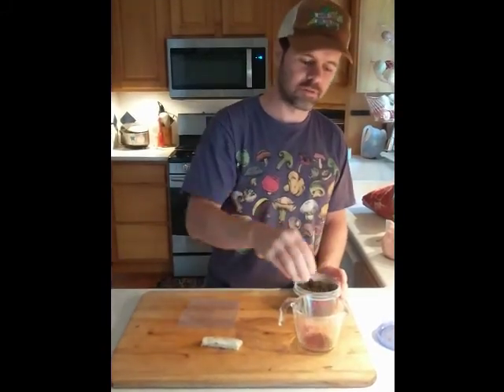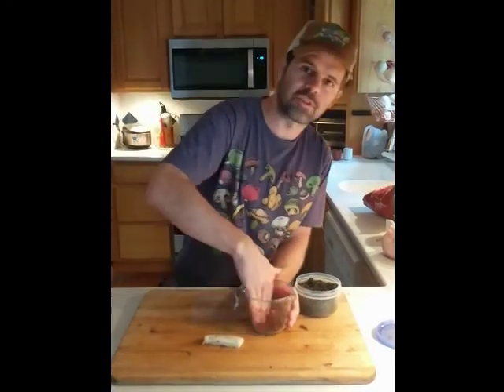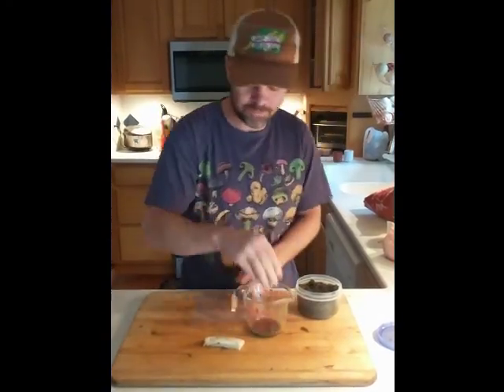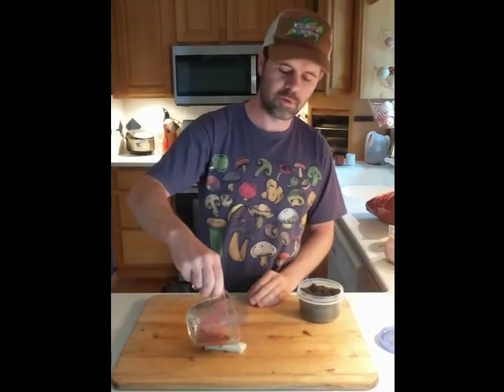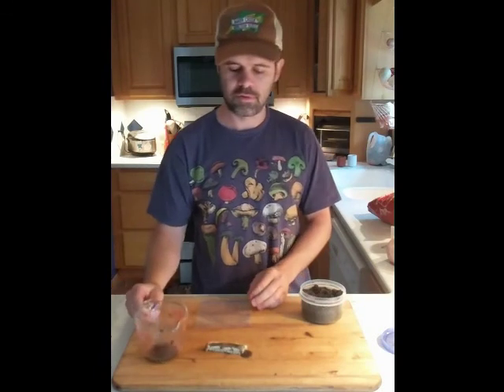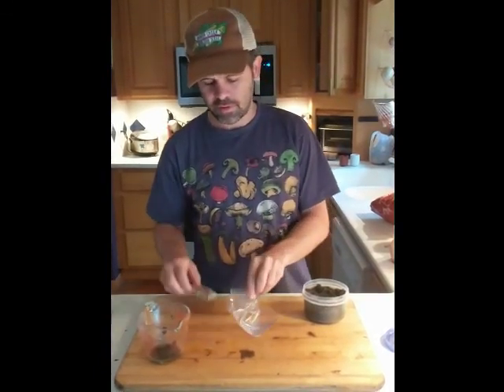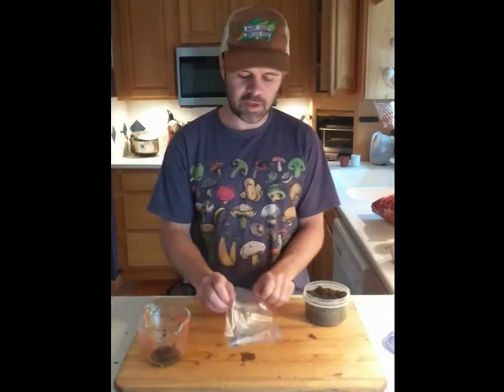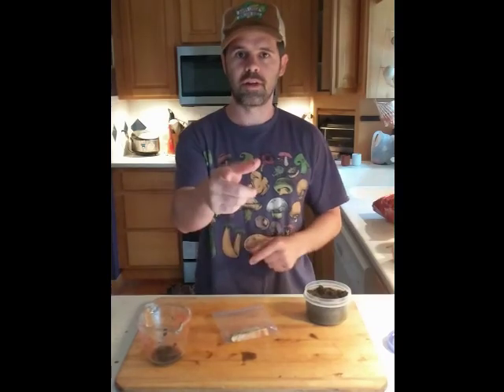Dirt into water. Shake, shake, shake. Smash it around. Pour dirty water onto bread — you don't want it sopping wet, just a little. Ta-da! Stick in a zip-up bag, leave some air in there. Wait a week. That's it. The end.